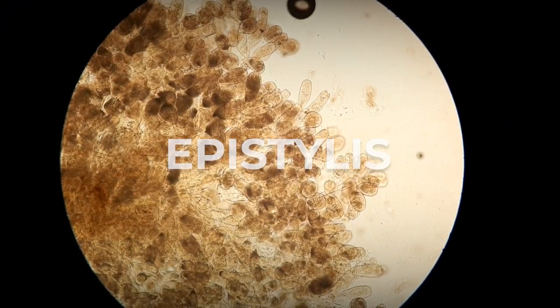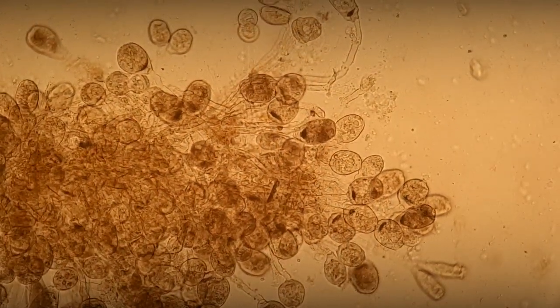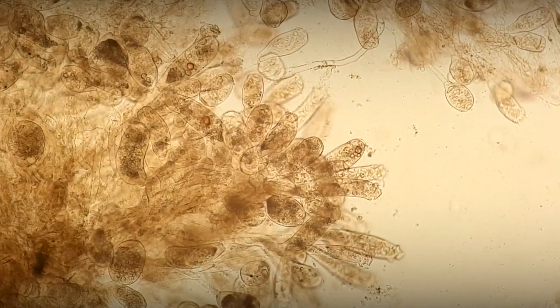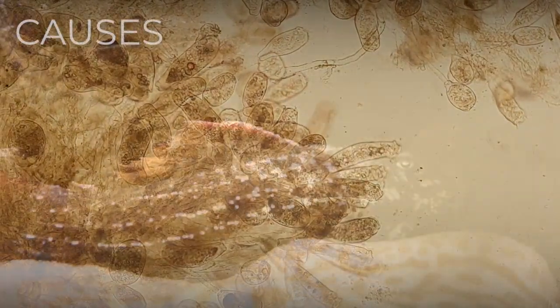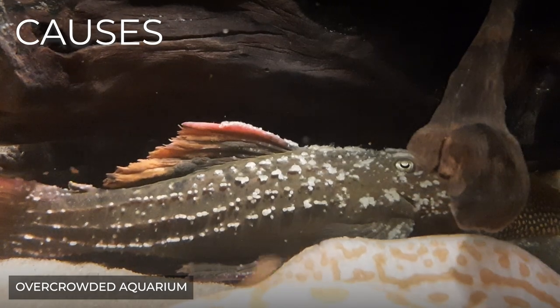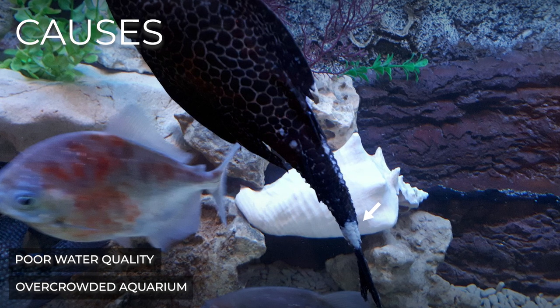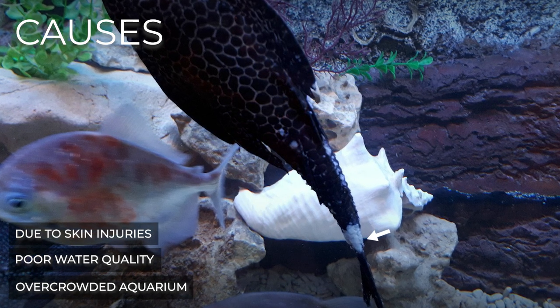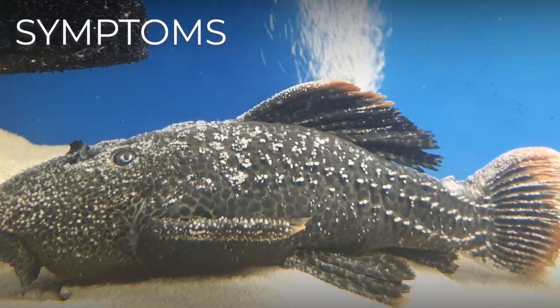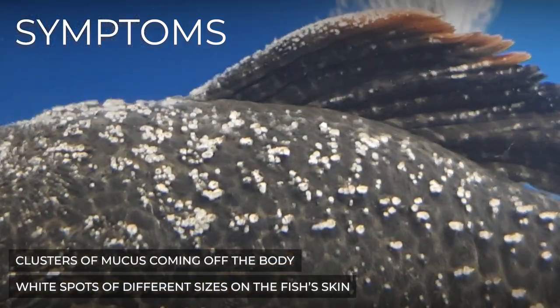Epistylis is a genus of colonial ciliates that can infect the skin of fish. It has an elongated shape with a crown of cilia on top and an attachment foot below. Fish become infected with Epistylis when kept in overcrowded aquariums with poor water quality, and it can also appear when skin injuries are present. Epistylis colonies appear on the fish's body as white spots of different sizes, or as a cluster of mucus coming off the body.